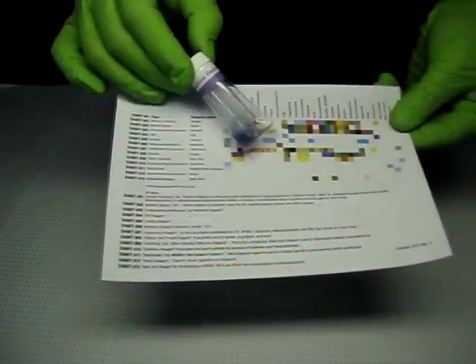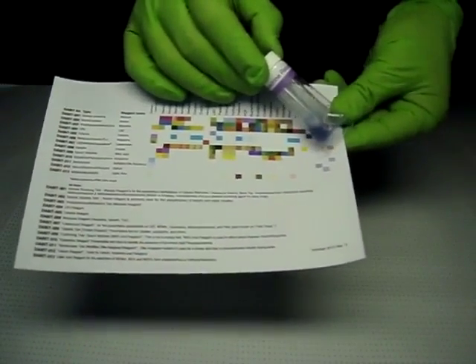Refer to the instructions to verify these steps and the results.